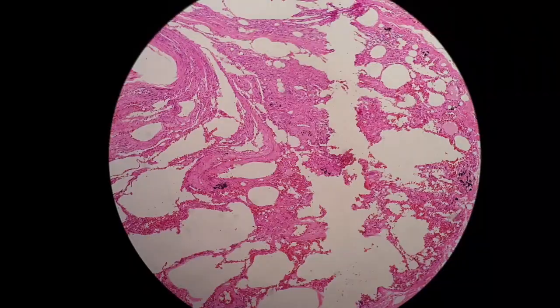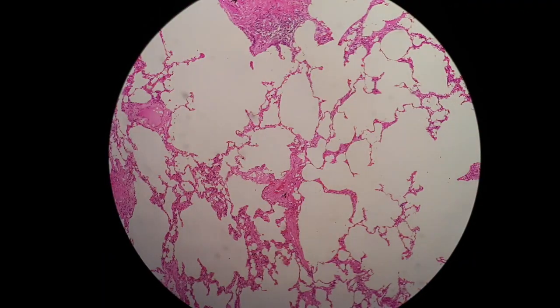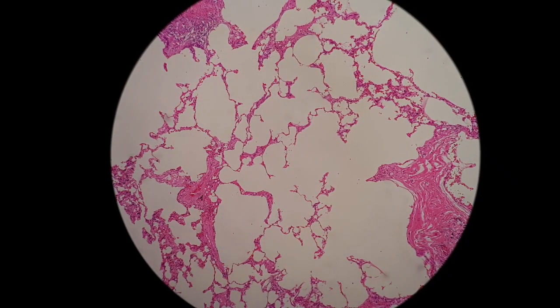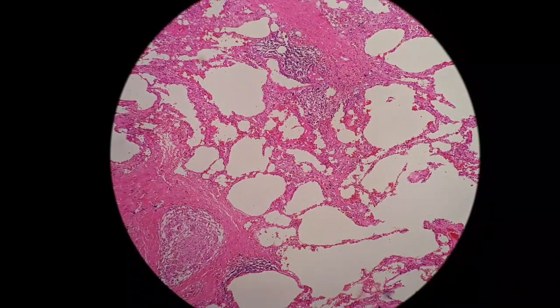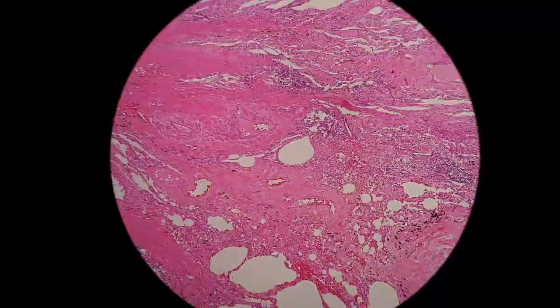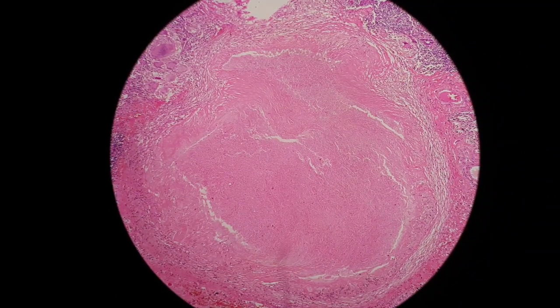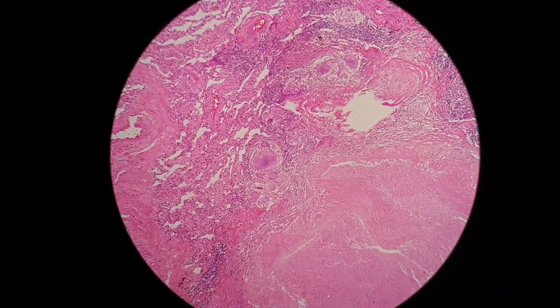Under medium power, we can see these alveolar spaces are lined by simple squamous epithelium. And this is the lesion — it consists of pinkish material at the center of it, and adjacent to it are the macrophages.